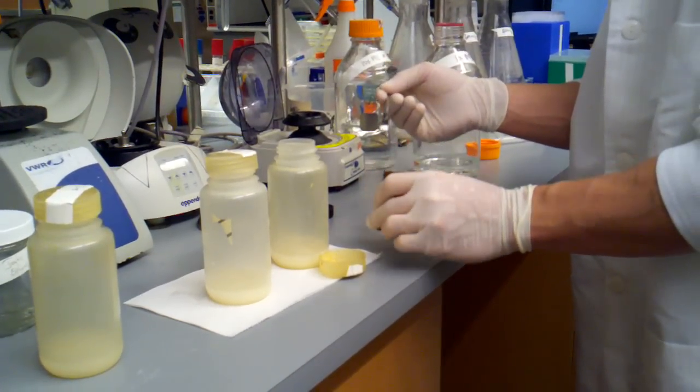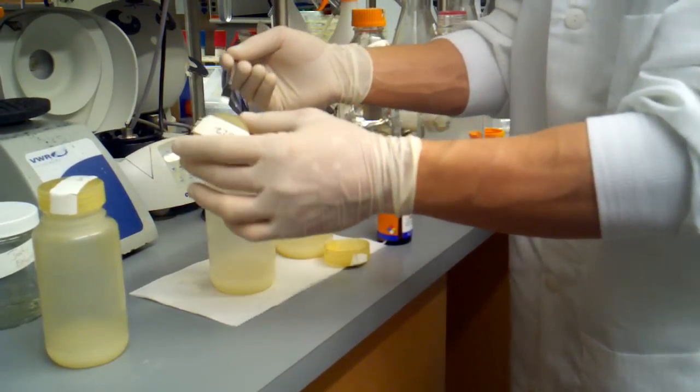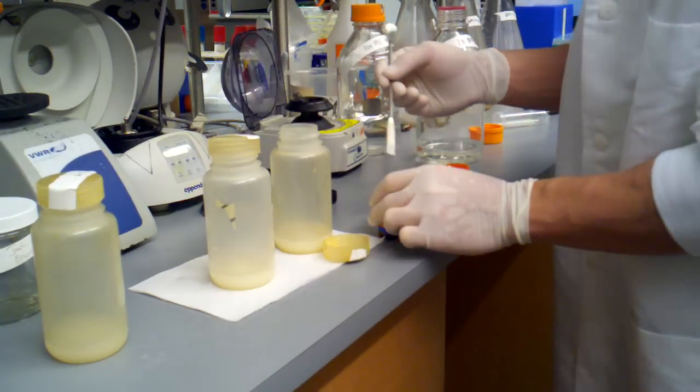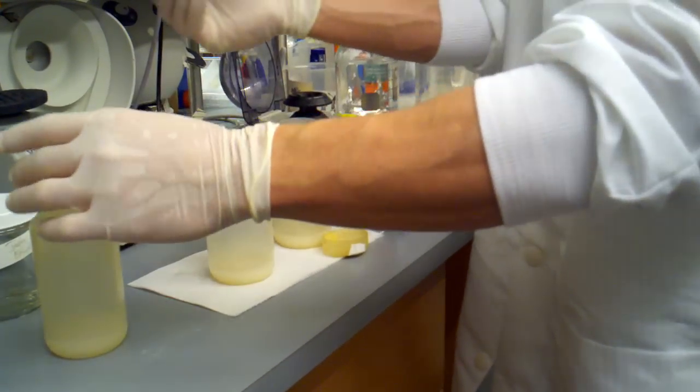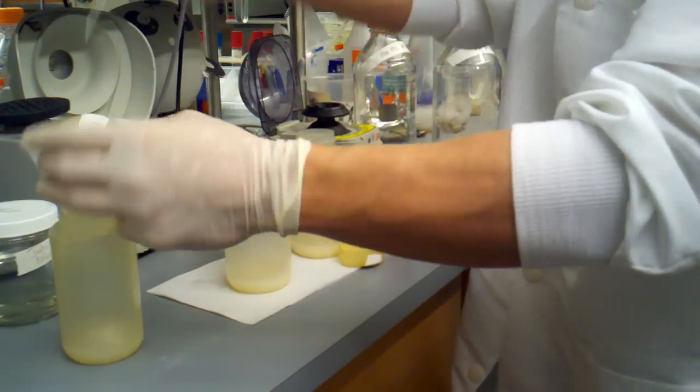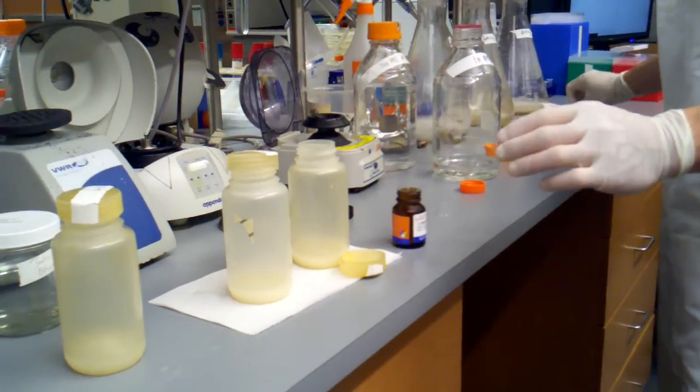About the same amount for each one. Again, we don't need these perfectly accurate.